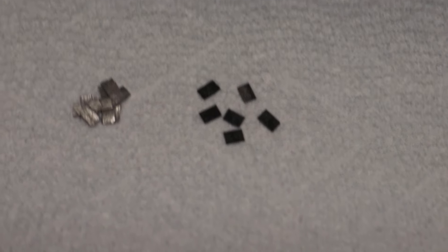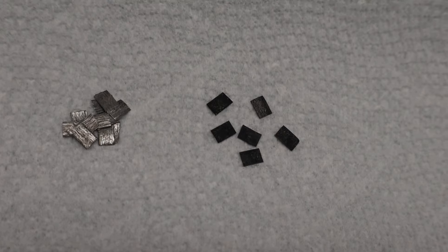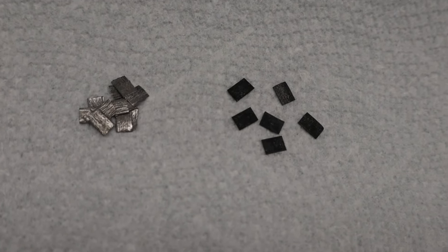Alright, so now we have the extracted samples, and you can see they're much darker in coloration than the original magnesium.